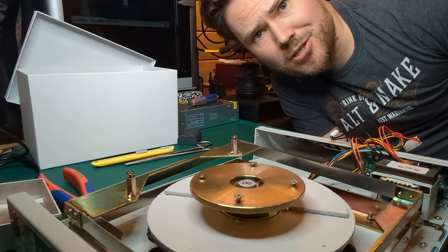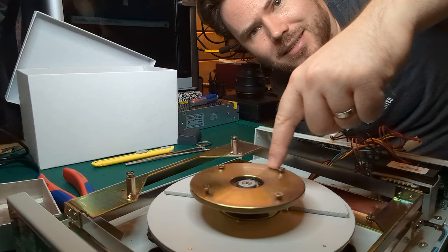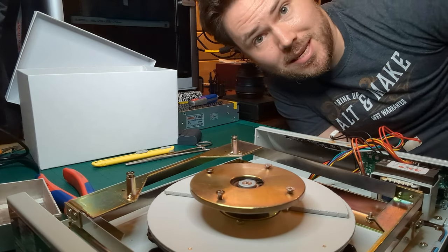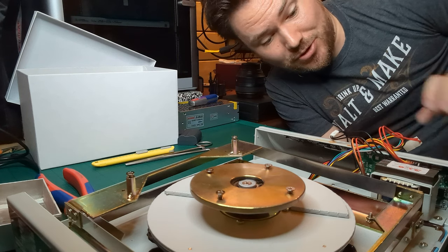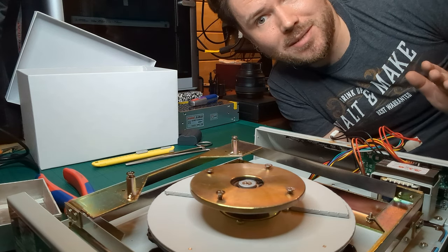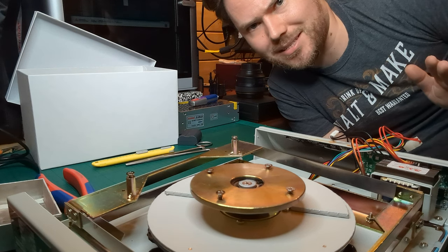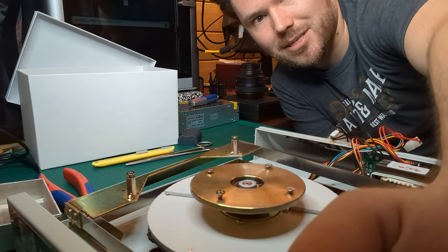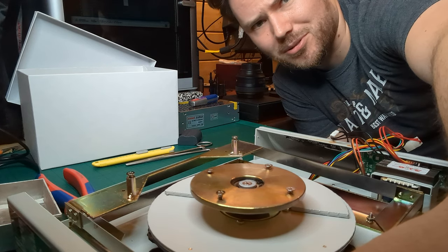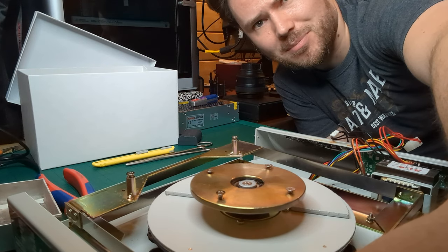You're right, this is a very strange camera angle, but it's the only way I can get this in shot and safely stay away from the power on this. This thing is plugged into the mains, so you really don't want to be anywhere near it. I've got enough experience that I'm happy doing this, but be really careful if you're going to do anything similar. I'm going to turn this on at the back, which is around here, and hopefully it won't explode. No magic smoke, fingers crossed.